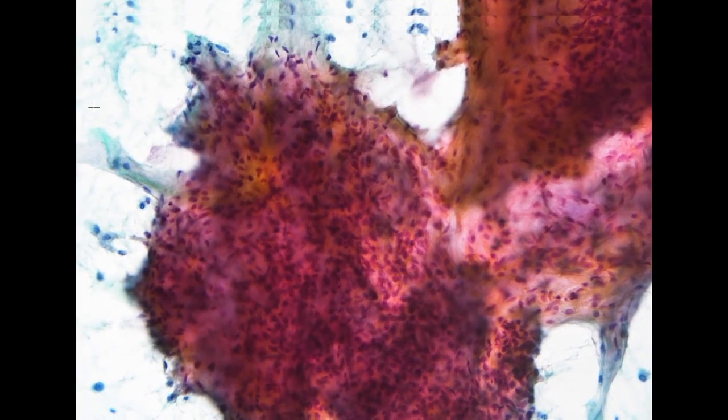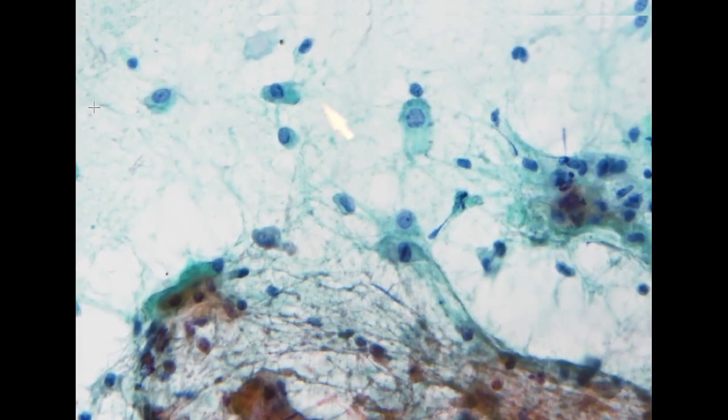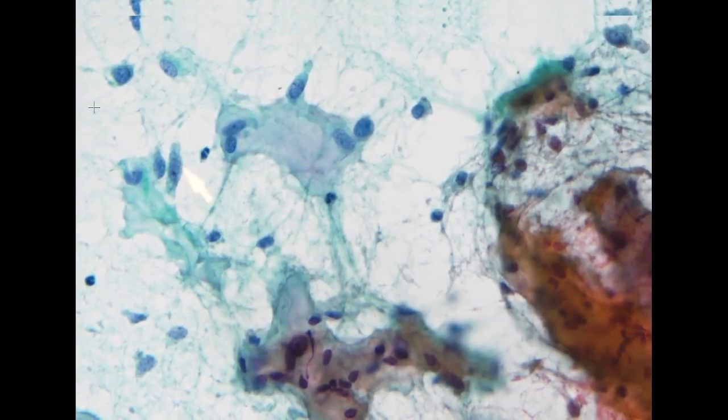So next, this is a parotid gland aspiration. We see some blood in the background and some cells as well, relatively hypercellular. And here we start to see this chondromyxoid type of matrix material, with oval-shaped myoepithelial cells with a very close relationship with this stroma. In the background, we have myoepithelial cells presenting with a plasmacytoid feature or a spindle cell feature.